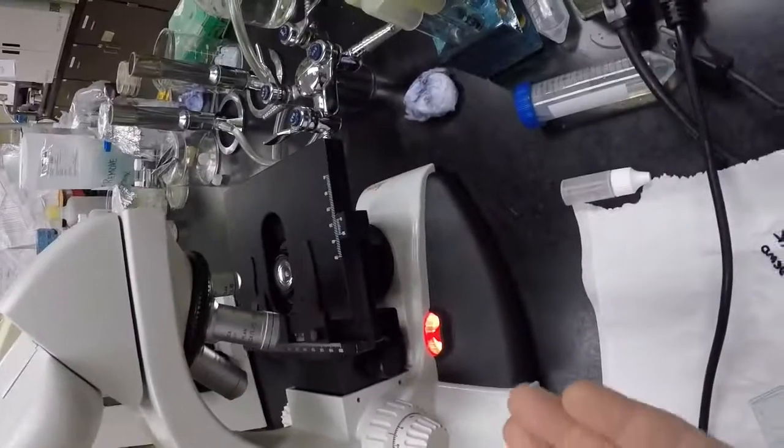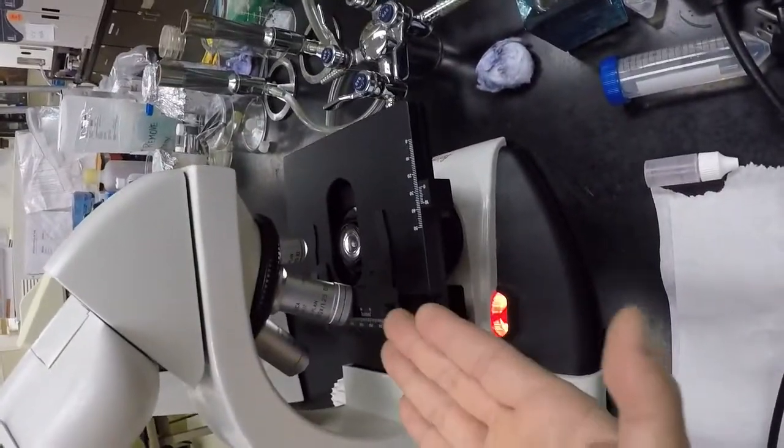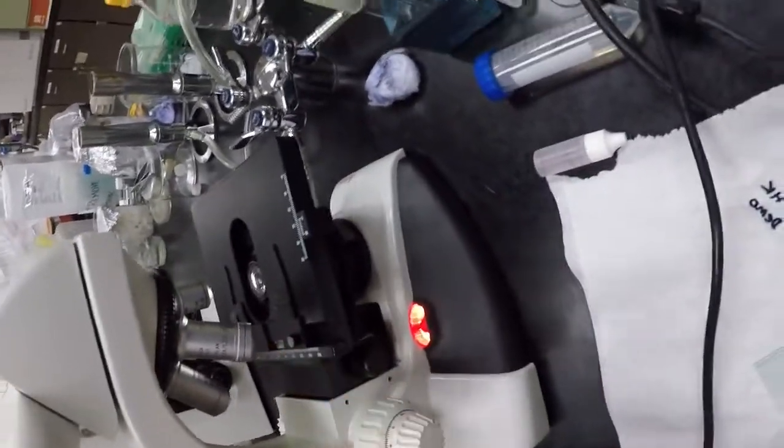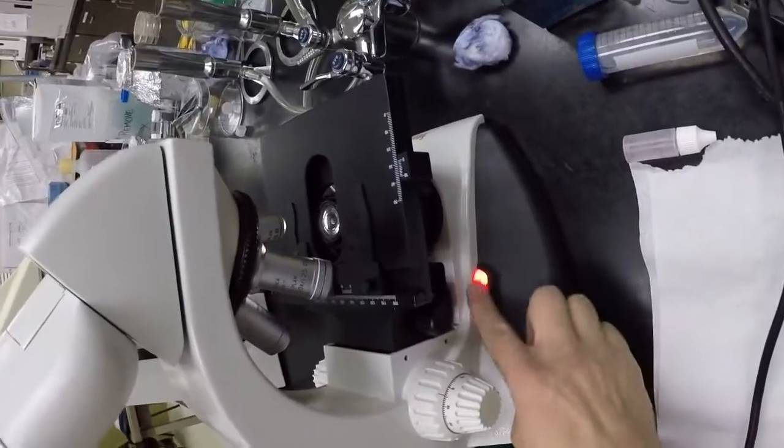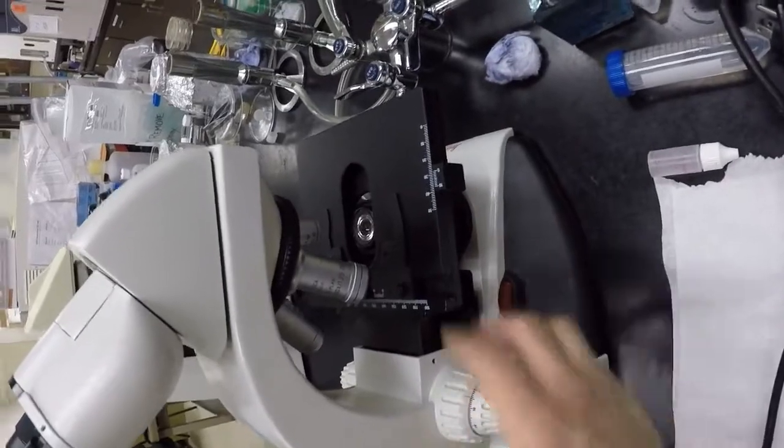And the 100, you don't have to rub it like crazy. Just a little wipe to make sure that the excess oil in there doesn't drip on the slide and get it all dirty, or the stage and get it all dirty. And that's it. Then turn off the light. Make sure it's in safe position when you put it away. Unplug it, wrap it up, and put it away.